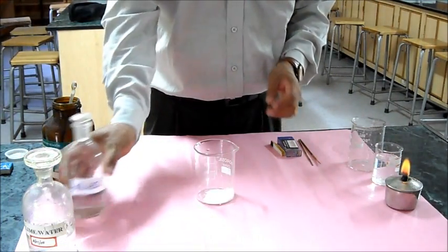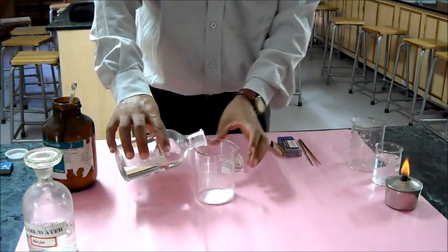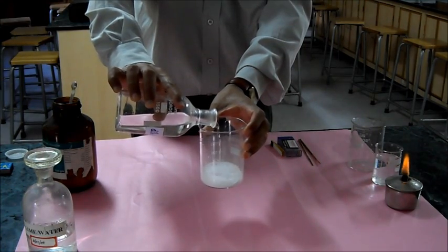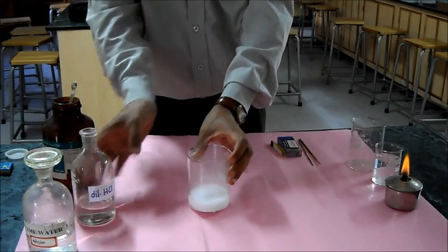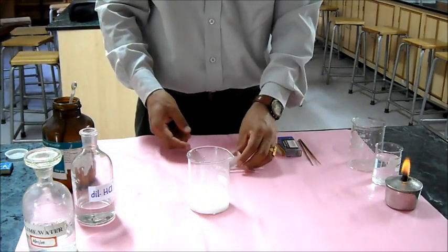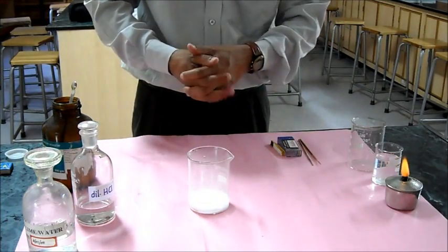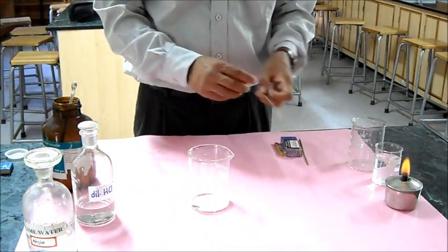Over it I pour hydrochloric acid. As you can see, as the acid touches the metal carbonate, some effervescence comes up producing the gas. The reaction takes place vigorously and the gas is produced.